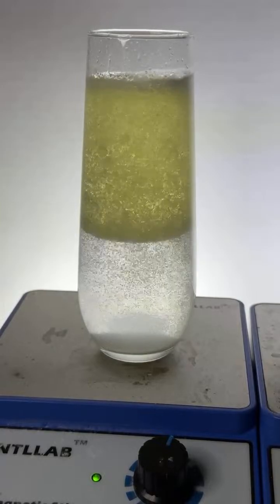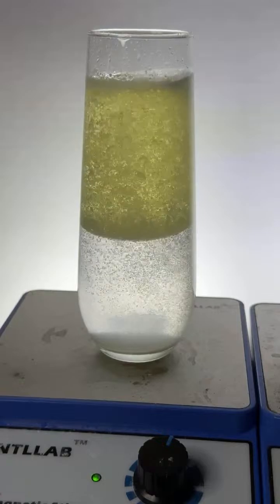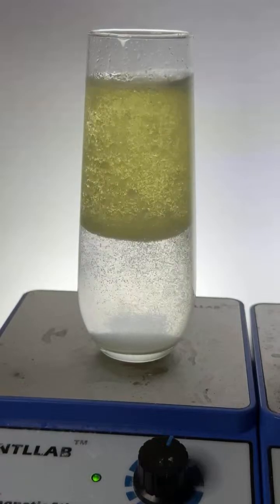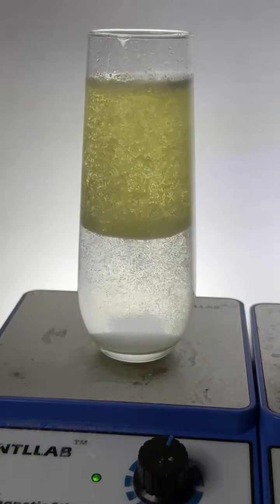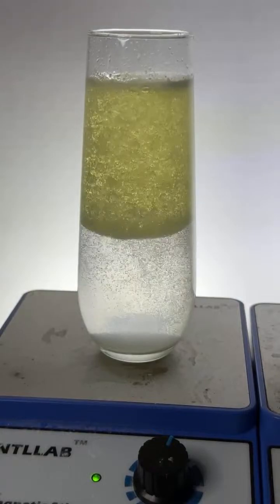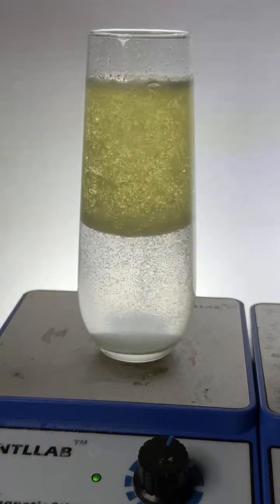Is there a way to create liquid carbon dioxide? There is, Administrator. You just have to be very careful. What you do is you place dry ice in a sealed flask. The issue there is that as the pressure builds up, of course, the flask can explode. But if you do it in a flask that won't explode, once the pressure exceeds a certain point, the CO2 will liquefy.